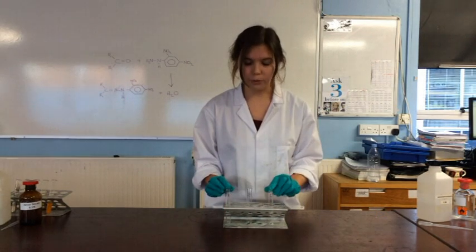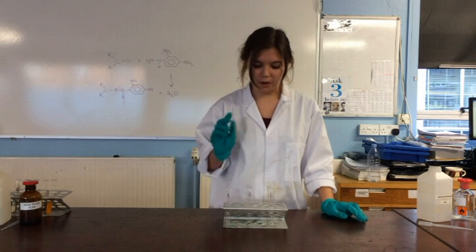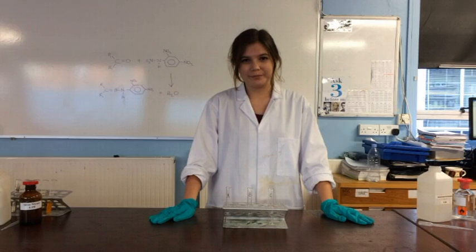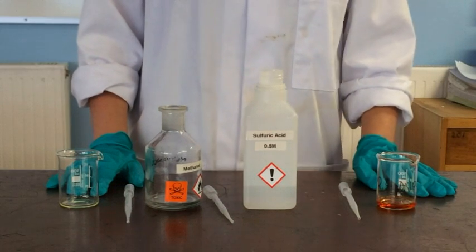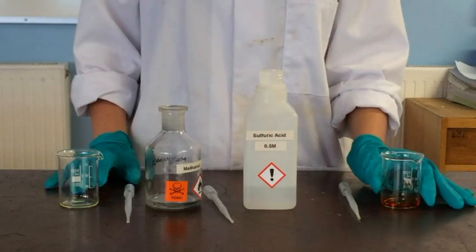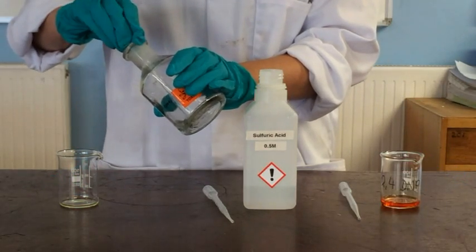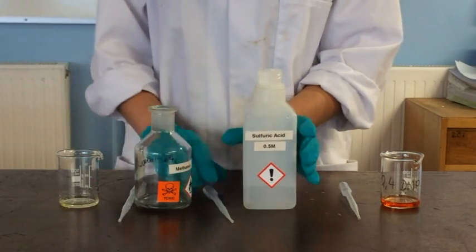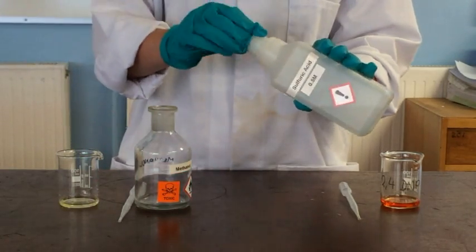So I'm going to add something called Brady's reagent to our unknown substances A, B and C and see what they are. Brady's reagent is 2,4-dinitrophenylhydrazine or 2,4-DNP in a mixture of methanol and dilute sulphuric acid.